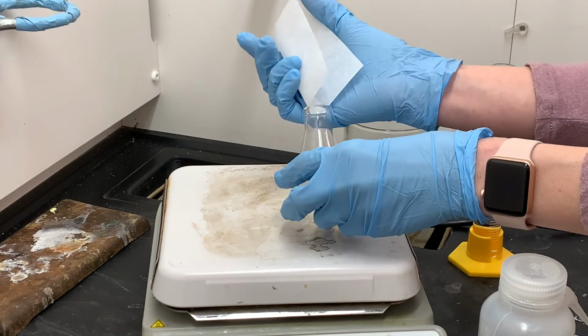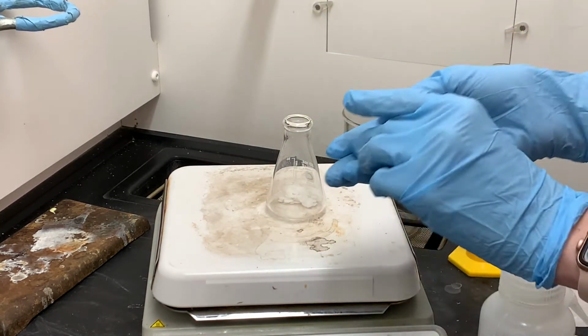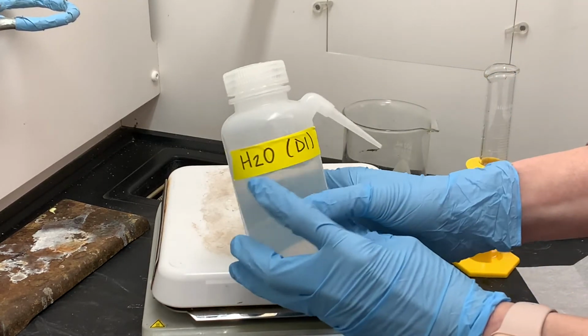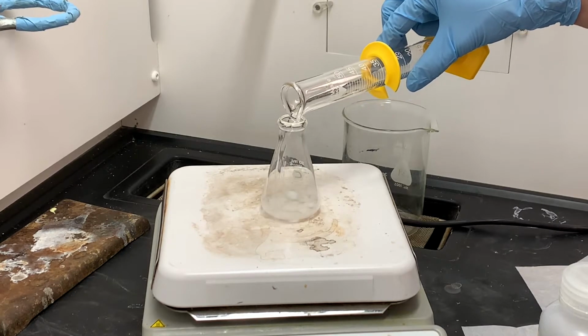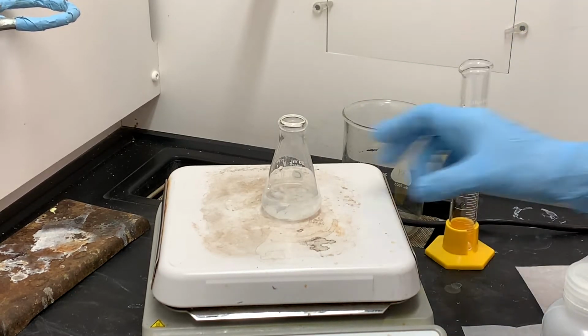First, I'm going to dissolve the maleic anhydride in water. Maleic anhydride does not dissolve very well in water. It's not very soluble in water. So to help it dissolve, I'm going to be stirring it with a little magnetic stirrer. And then the water, I'll be using 15 milliliters. I'm going to heat it up, and it should all be dissolved at around the time that the water reaches its boiling point and starts to boil.